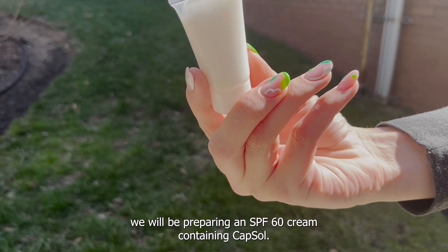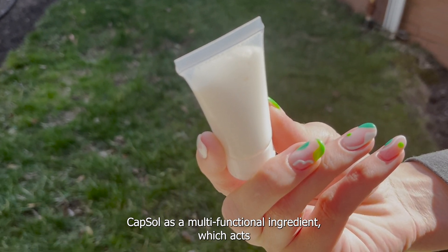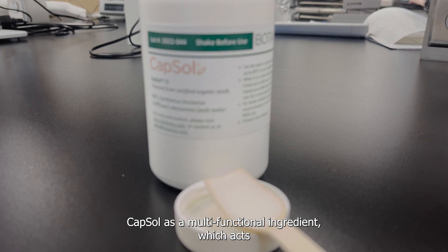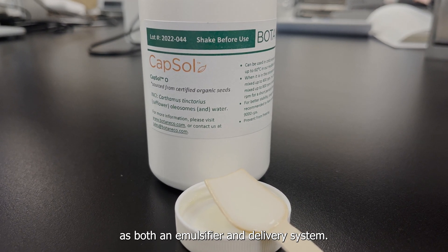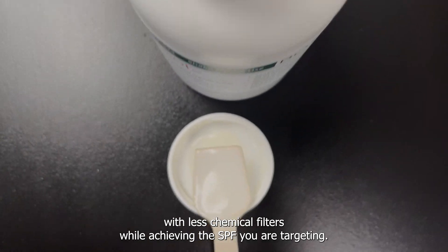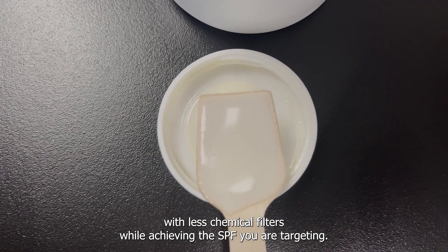Today we will be preparing an SPF 60 cream containing Capsol. Capsol is a multifunctional ingredient which acts as both an emulsifier and delivery system. It allows you to formulate with less chemical filters while achieving the SPF you are targeting.